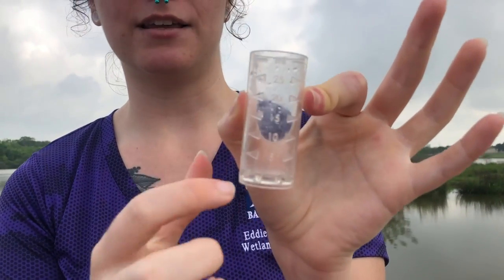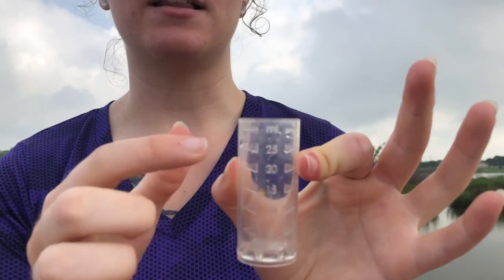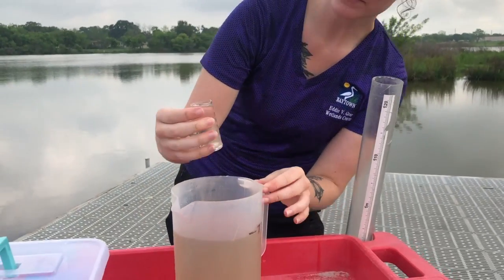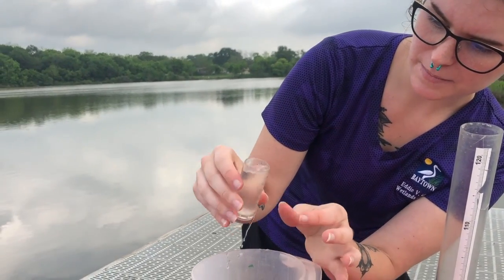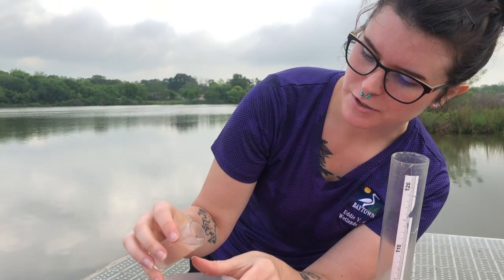So our next one is going to be a graduated cylinder. Some of them look a little bit different than this one, but we're going to see how we use a graduated cylinder and count these increments. So I'm going to put about 25 milliliters in this one. I'm going to dip it into our water. Right now it's at the top, and I'm going to pour some out. My hands are really shaky. Okay, maybe I'll do 20 because I poured too much water out.